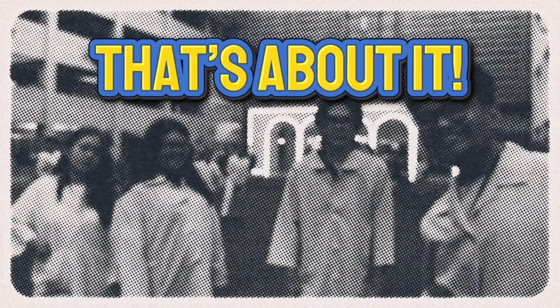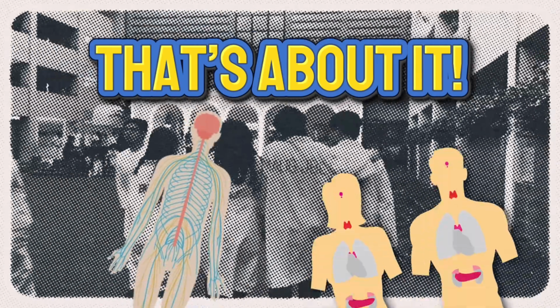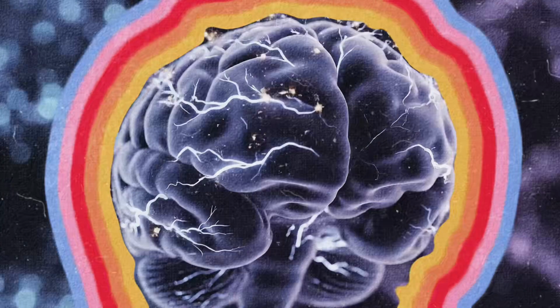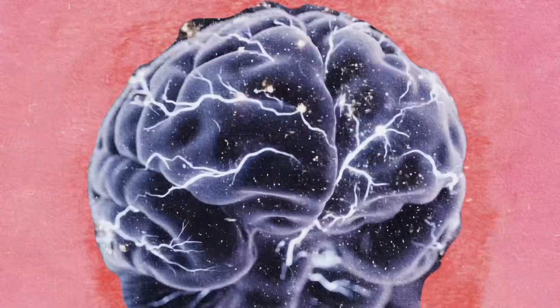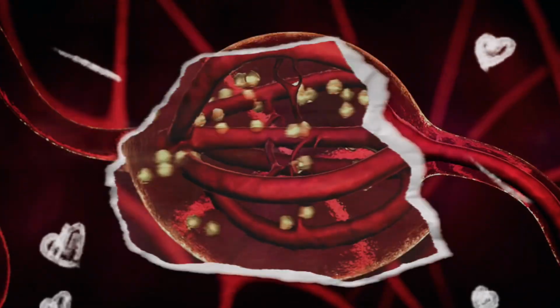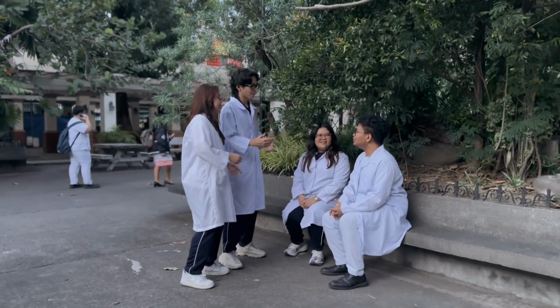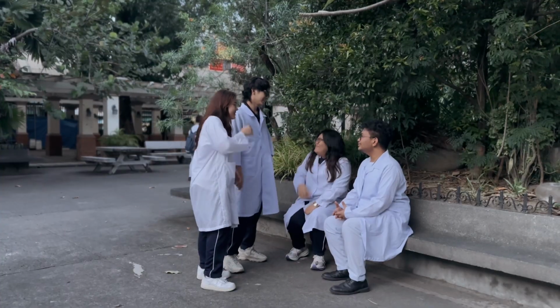And that concludes our laboratory demonstration for the nervous and endocrine systems. We explored the major structures of the brain, the pupillary light reflex, and how the body responds to the sympathetic and parasympathetic systems. We also examined the endocrine glands under the microscope and identified their key hormones and functions. Through these activities, we learned how these two systems work together to keep the body balanced and functioning.